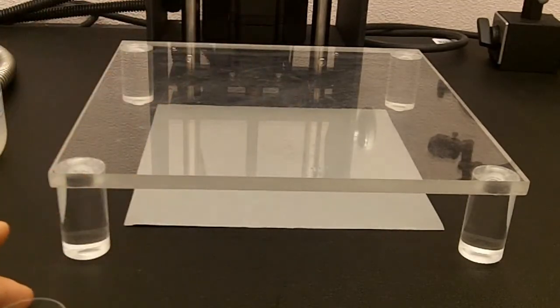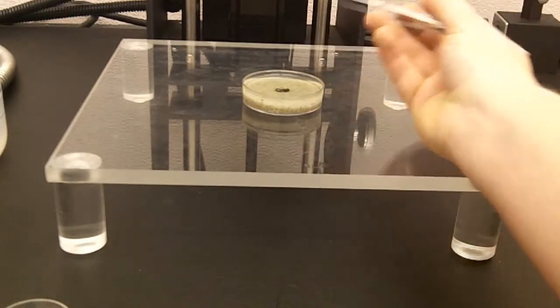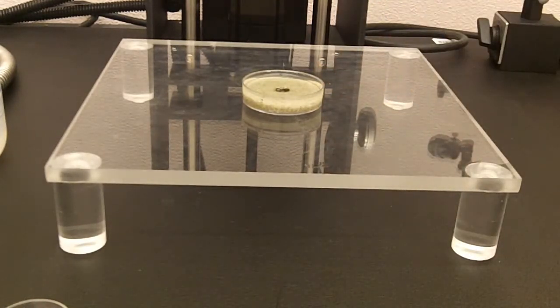If you are using sand, you really don't need any kind of added background, because the background will be the sand, and you won't even see any paper or other type of background you would use. So that's the basics of preparing ethanol specimens to be imaged.